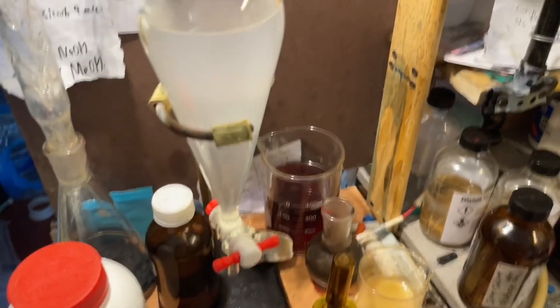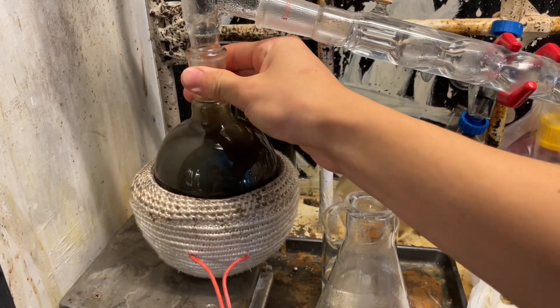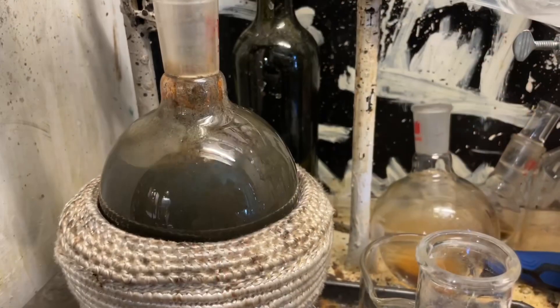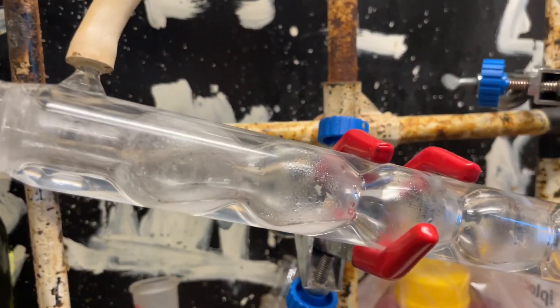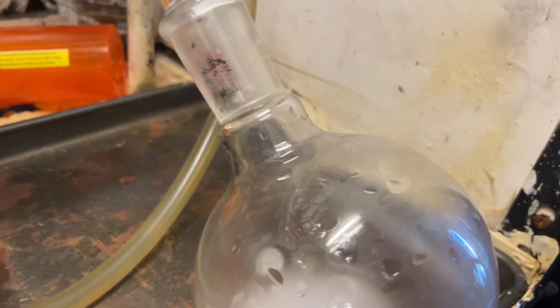So we're going to take off the dichloromethane nitrobenzene into a flask and dry it. It is starting to boil only after I agitated the flask, which is a bit weird. It's boiling now and it does not seem to be foaming, which is a good sign. You can see our distillate is in fact cloudy, which means we're distilling over our quinoline. Now I've got the water addition rate roughly matching the distillation rate.